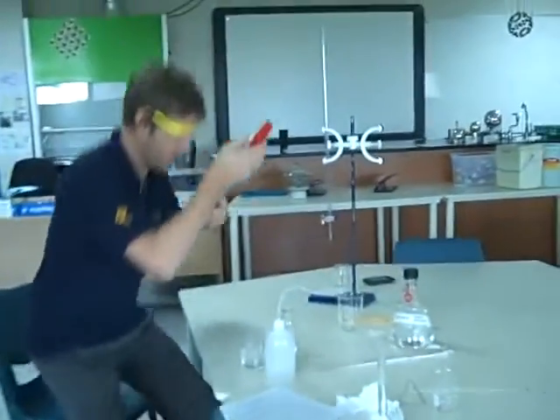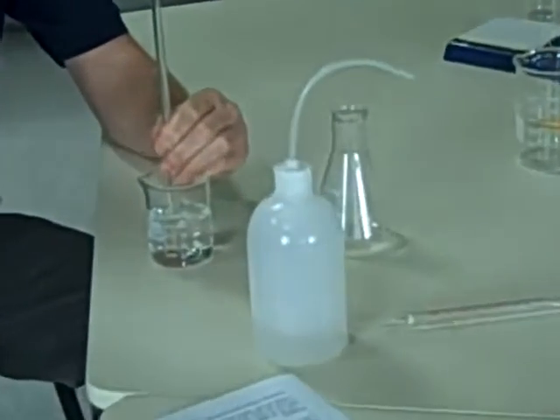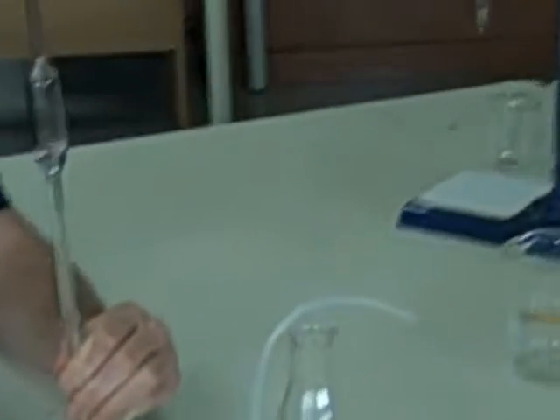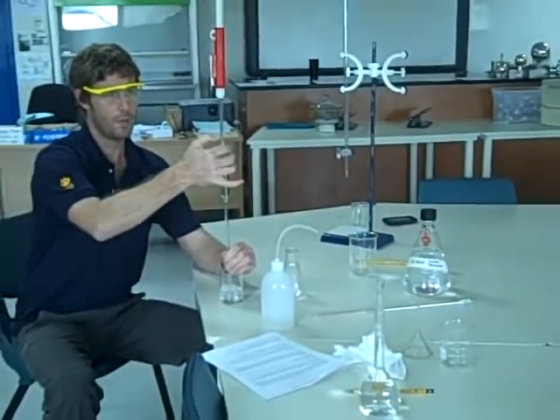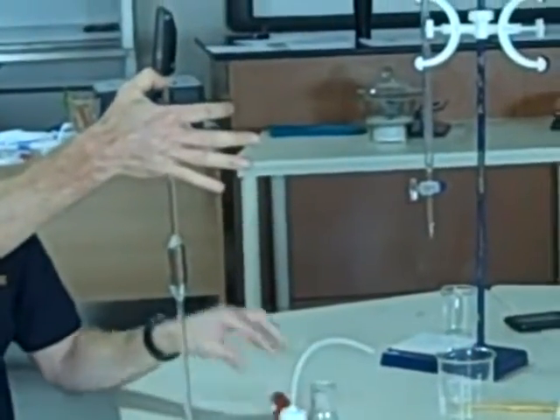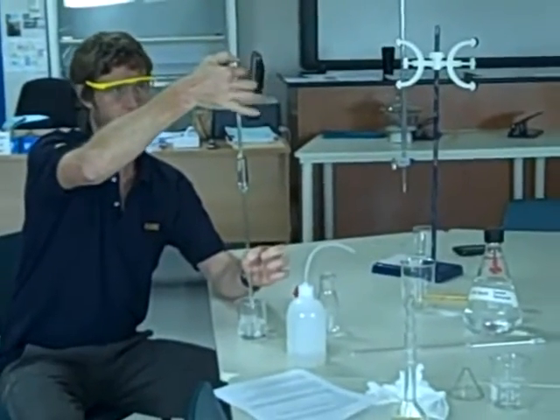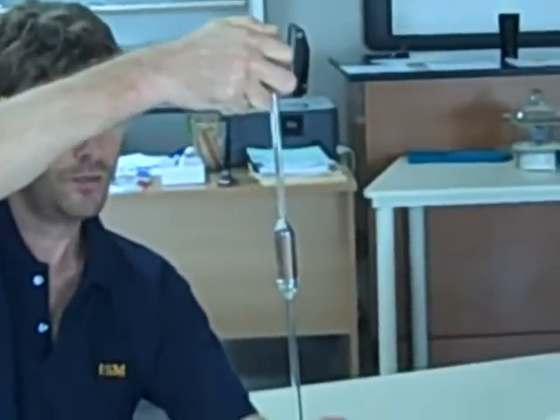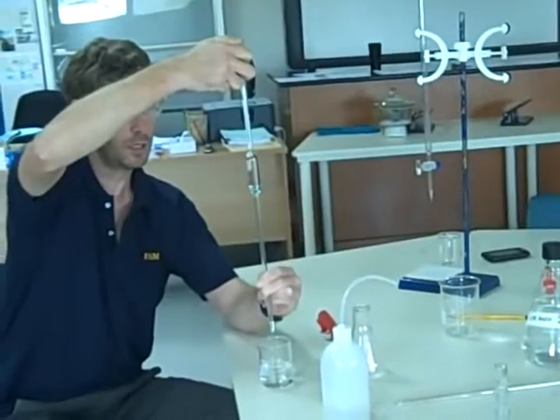Pull down. And then, putting the tip of our pipette under the surface but not on the floor, we bring the sodium hydroxide up. And I will always make sure it goes past the graduation mark because then what I will do is very carefully slide my thumb up and put my thumb over the top, so I've now got just more than the 25. Evolution has created our thumbs with a thumbprint which allows us to control the exit of water from here very carefully, drop by drop, until the bottom of my meniscus is right on the level.